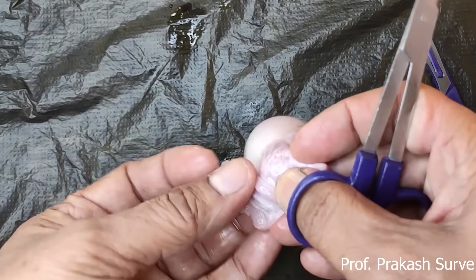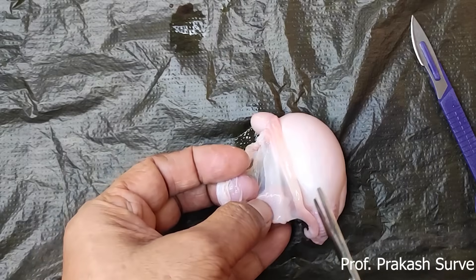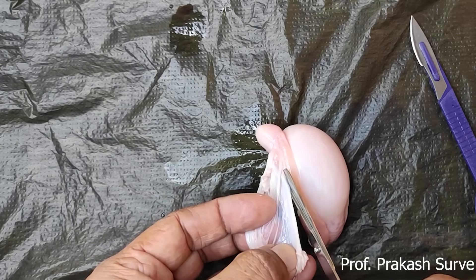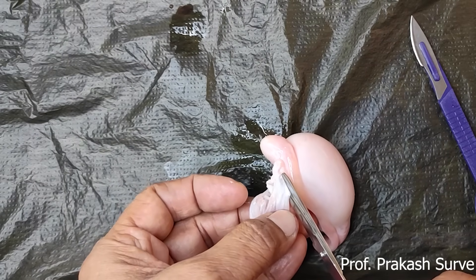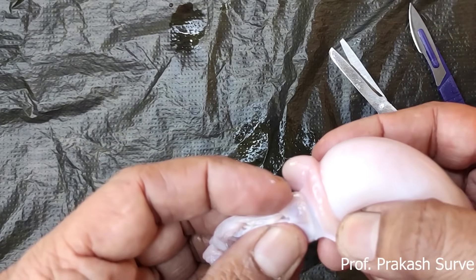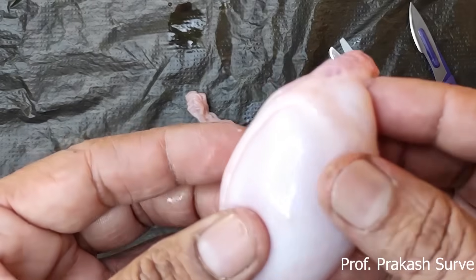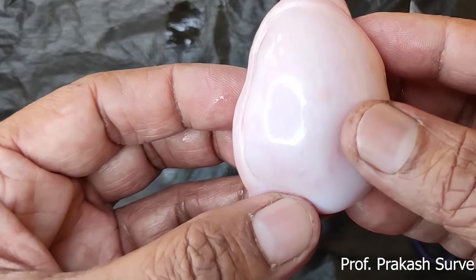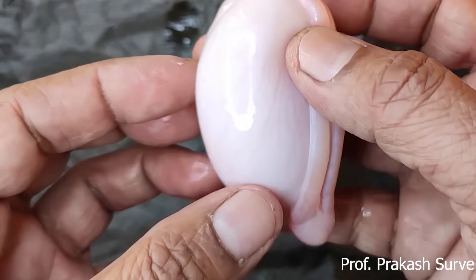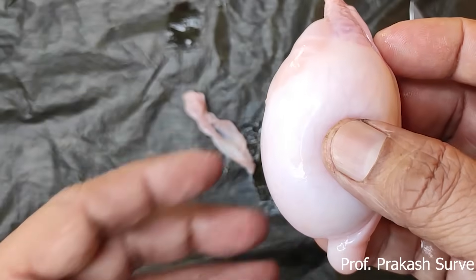Then slowly we will dissect the testes. We will find both LS as well as TS — LS means the longitudinal section, TS means the transverse section. Carefully we have to remove this. Here inside we can clearly observe that a number of seminiferous tubules are present. You can watch clearly.